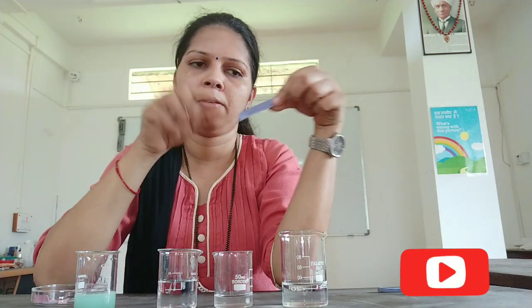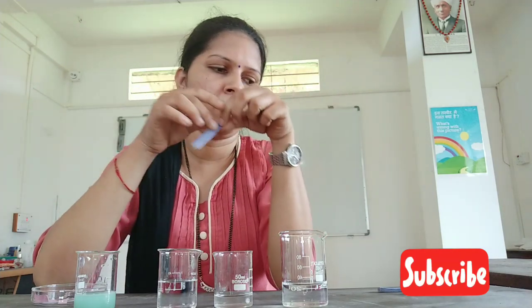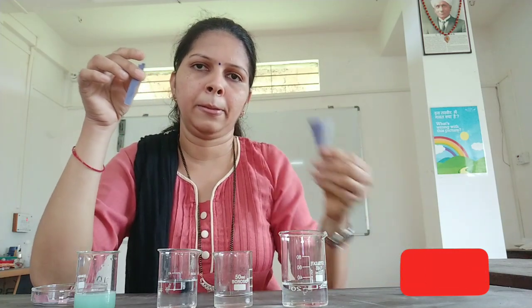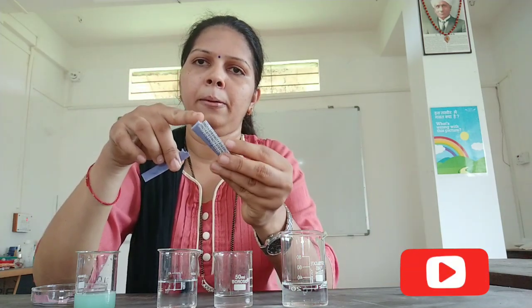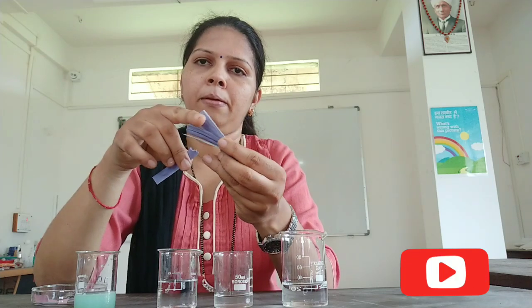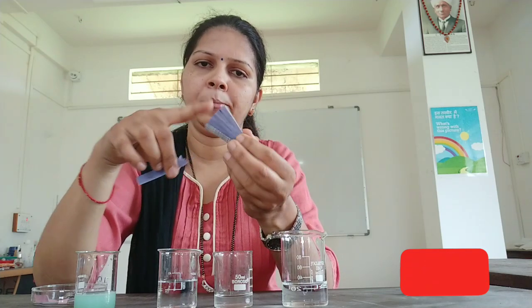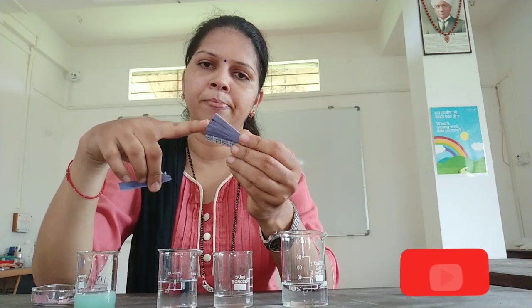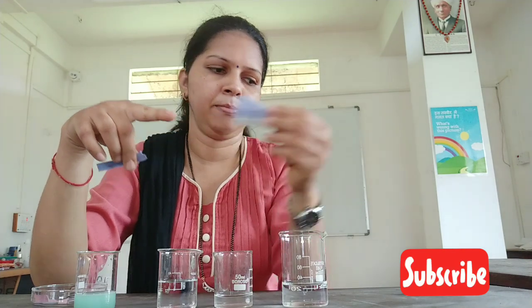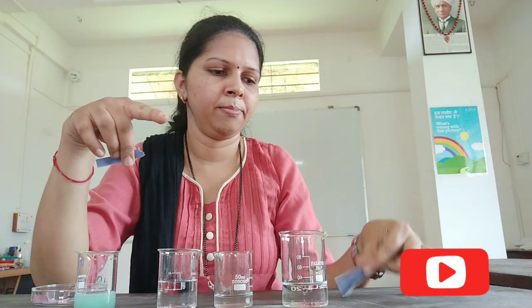One such common indicator is litmus paper. Litmus is a natural indicator. It is extracted from a plant called lichen, which is a symbiotic relationship between algae and fungus. There are two different types of litmus paper: red and blue color litmus paper.